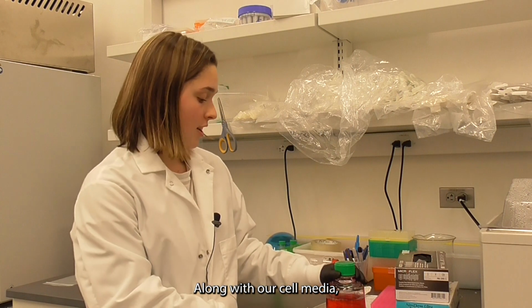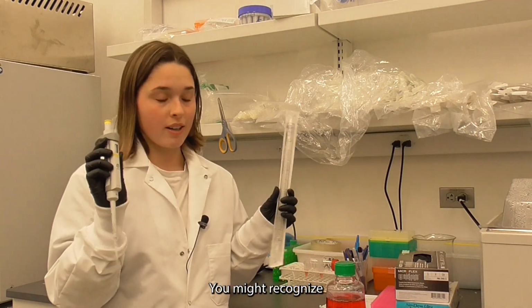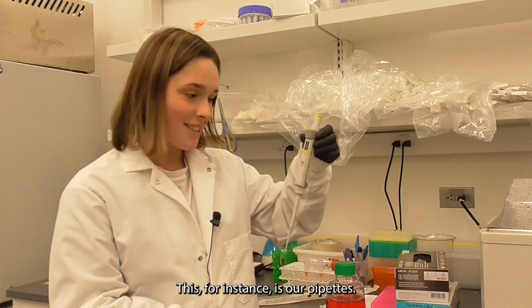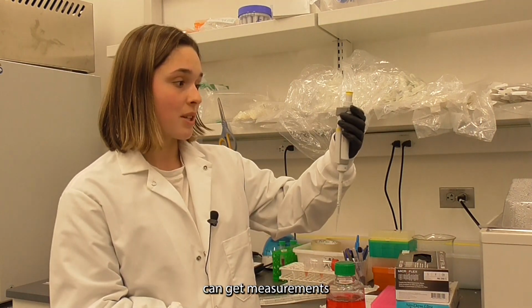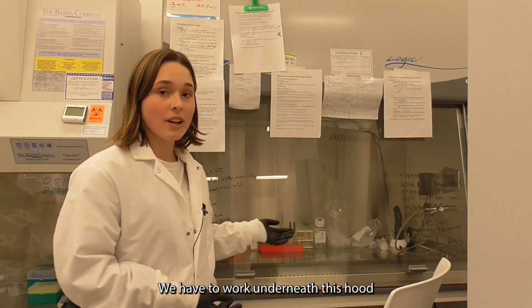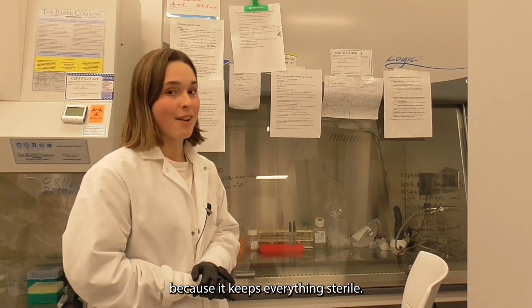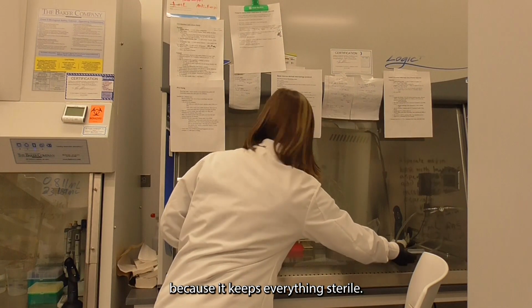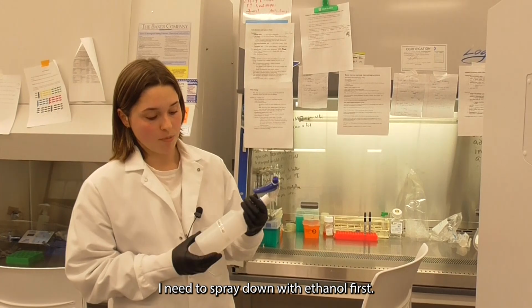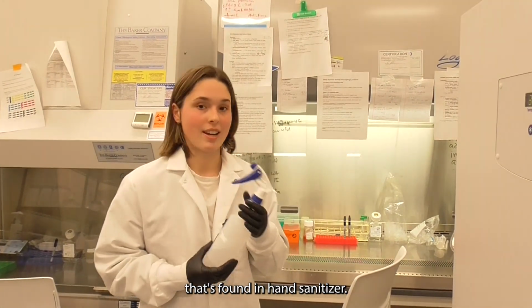Along with our cell media, here's some of the other equipment that we use when we work with our cells. You might recognize some of these materials. This, for instance, is our pipette. This one specifically can get measurements all the way down to 2 microliters. This is the cell culture hood. We have to work underneath this hood whenever we do any cell culture experiments because it keeps everything sterile. Anything that I'm going to use underneath the hood, I need to spray down with ethanol first. Ethanol is the same ingredient that's found in hand sanitizer.